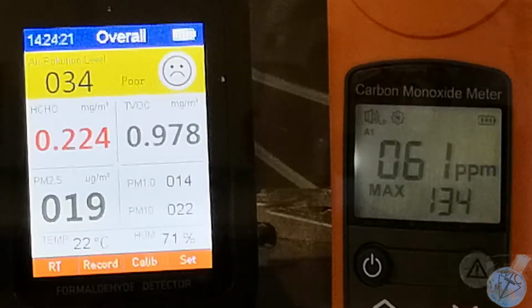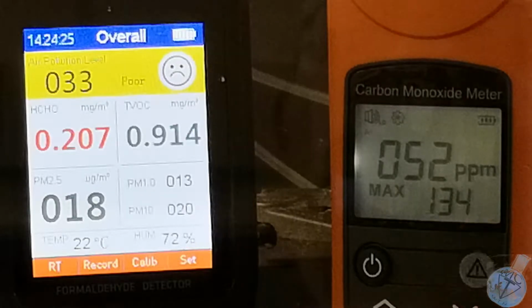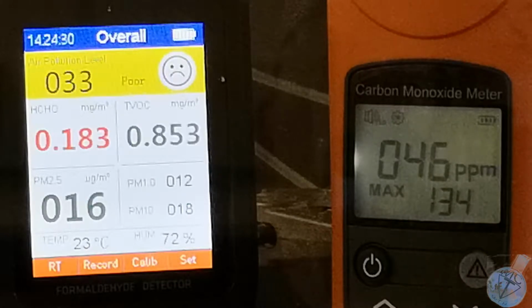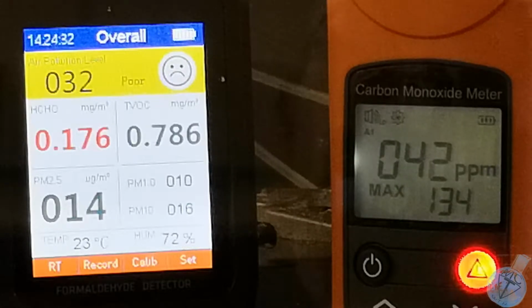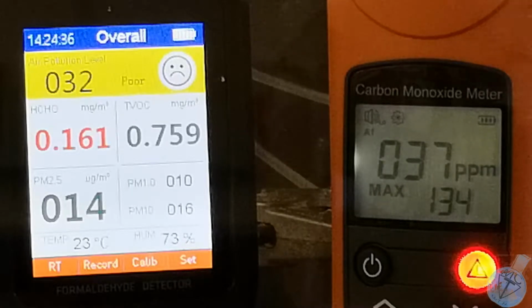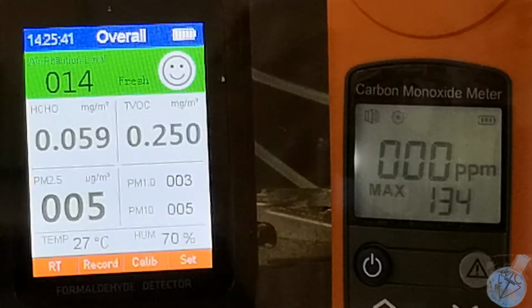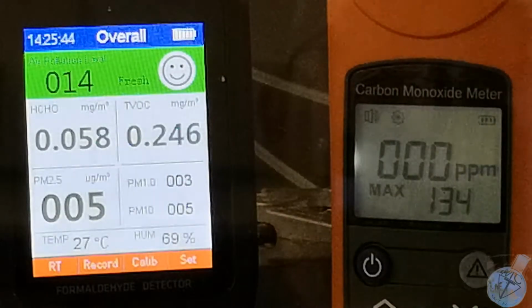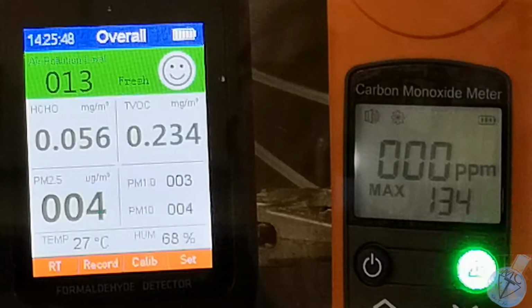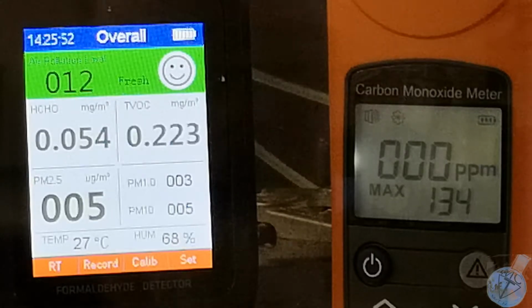And we've gone into 34 micro frowny faces on the left. The frowny face is the metric unit for air particle pollution. The pre-metric for frowny faces was bilious complexion. A single Bunsen burner trapped in what looks to be about a 2 cubic foot box. We now have no carbon monoxide in there at all, and we have nearly zero particulates.